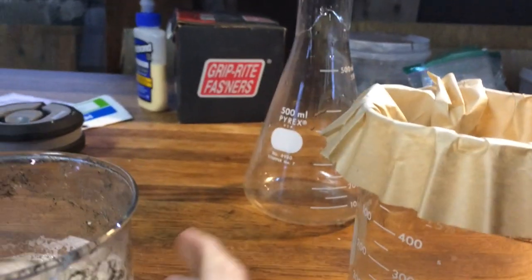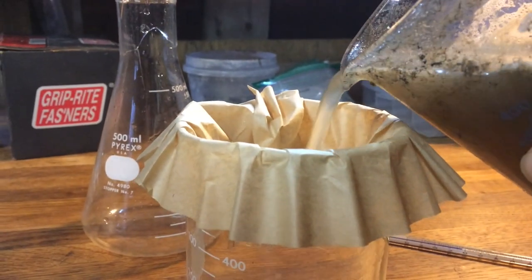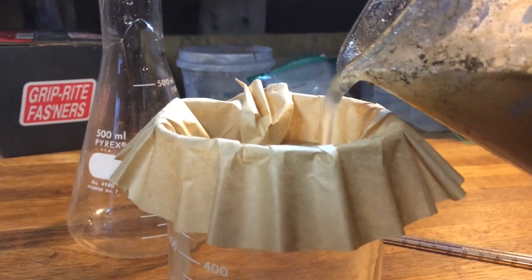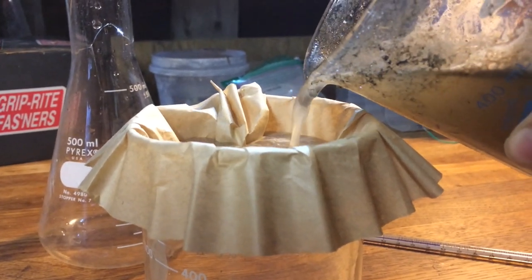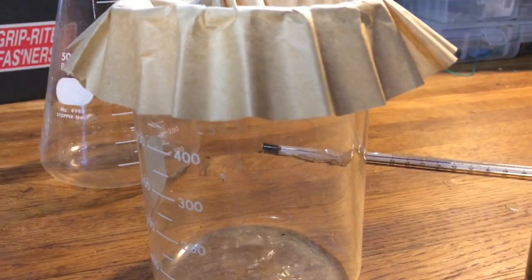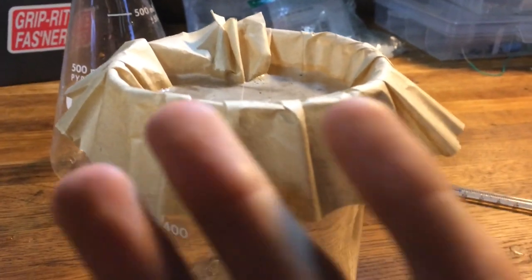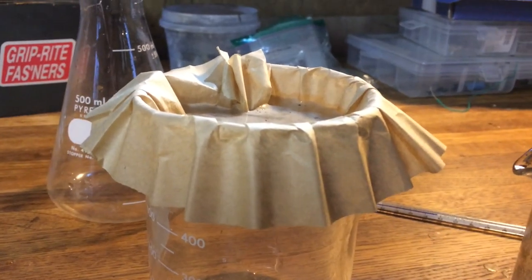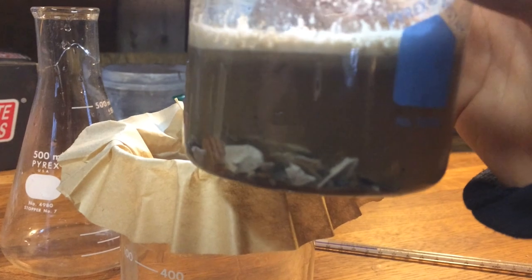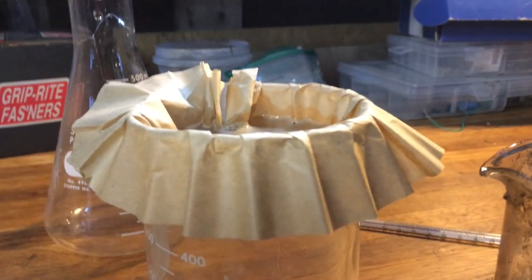I just have a simple coffee filter set up here. You could possibly just use a sieve for this, but the powder wouldn't get out. A paper towel may have been a better idea, because it's more porous and it'd be a lot faster. But the main idea is just to get the stuff that didn't react with the hydrochloric acid out.